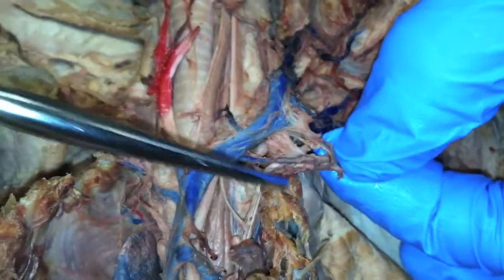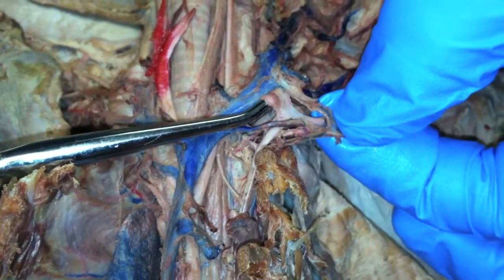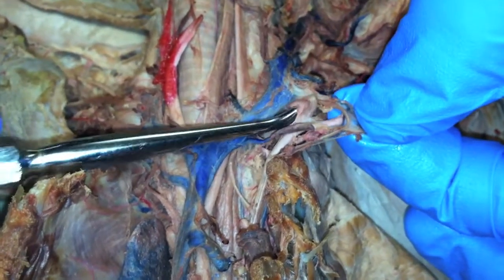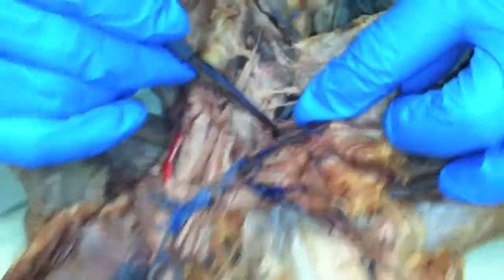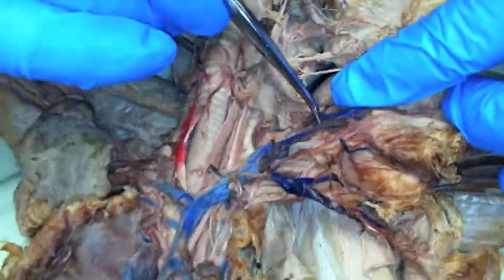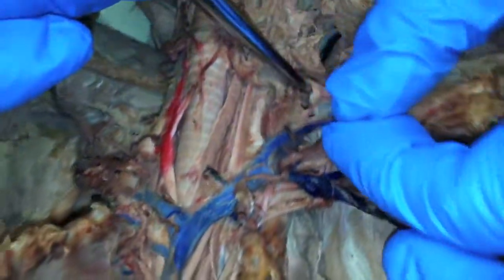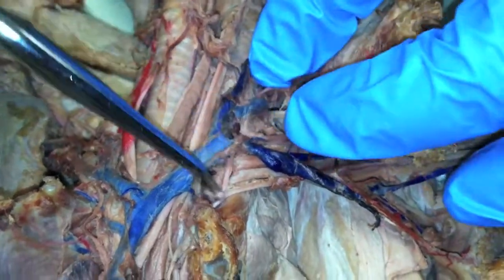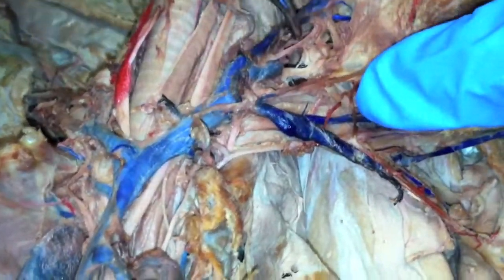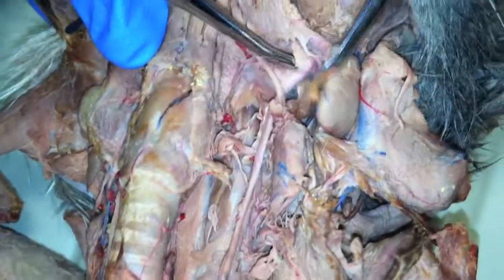So there's your costocervical right there. And then the one next to it, your thyrocervical. Transverse scapular going across, coming down from it there. It's continuing on down that way. So it should be coming through right there — that's your thyrocervical. This is lingual coming up. And that's an external. And then where's the internal? Looks like it's back in there.